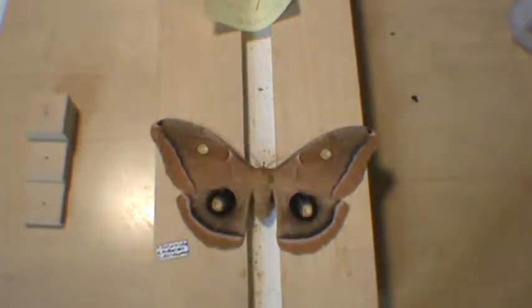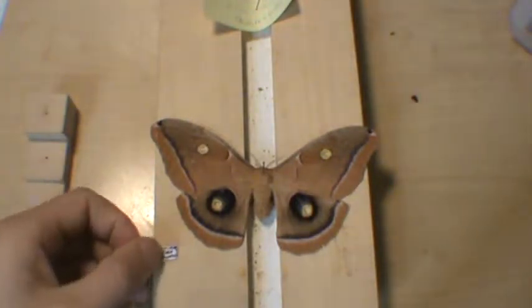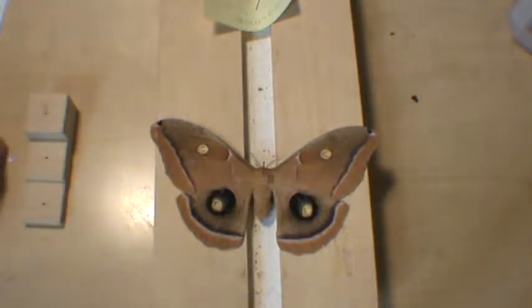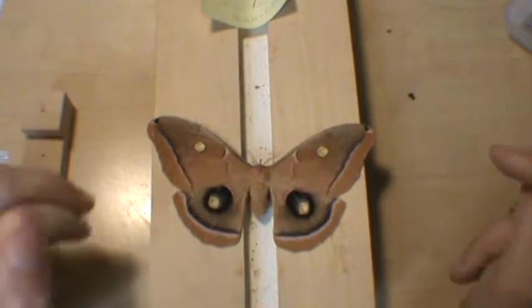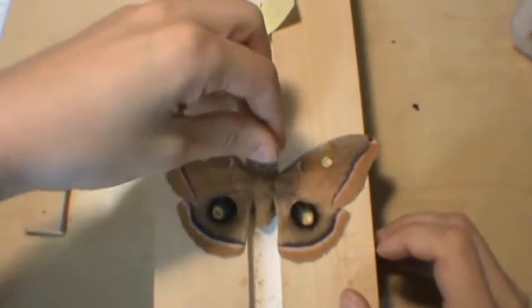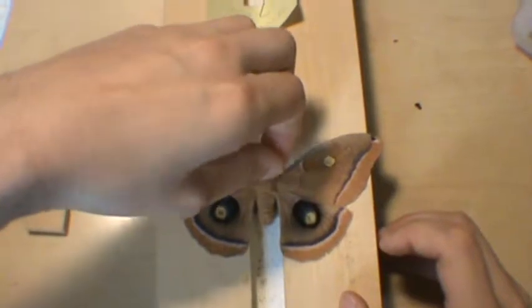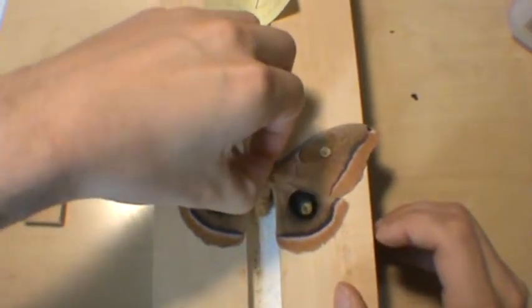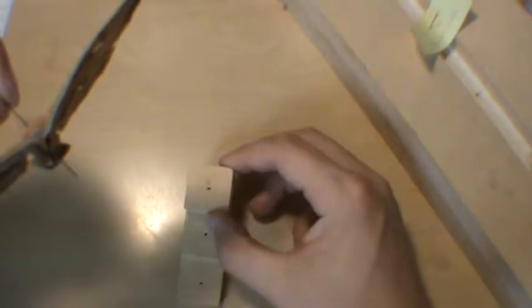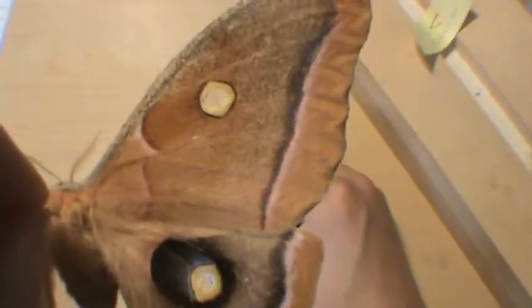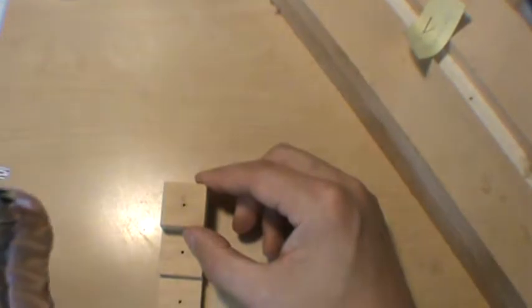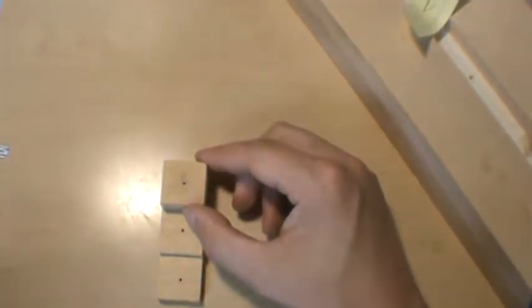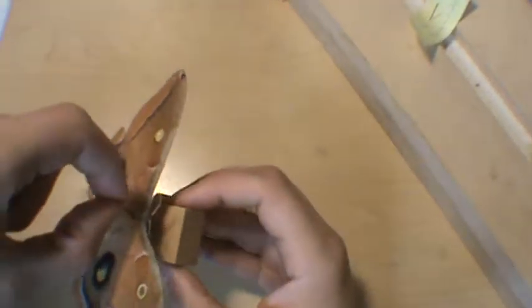Let's go ahead and put the collection stuff down here. I like the name so that I can pick it up and quickly read it. This is some tough stuff here. Ready? Careful. There we go. Look at that. Isn't that a beautiful moth? You can see those colors now. What's neat is you can actually see where it looks clear in the middle of the yellow circle. Well, that's actually a membrane through there. We're going to slide the bug on the pinning board just like this.